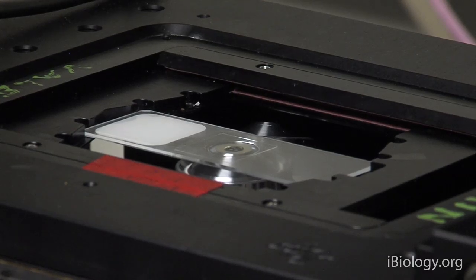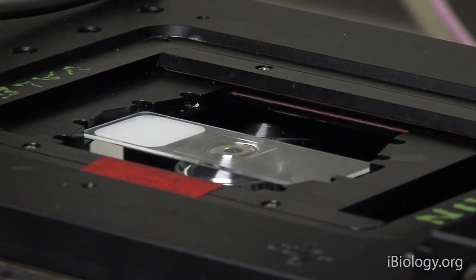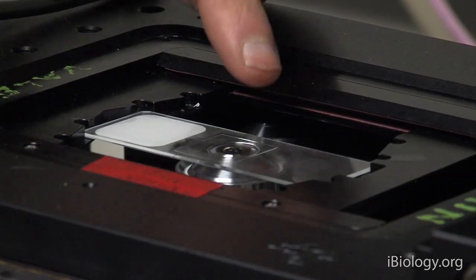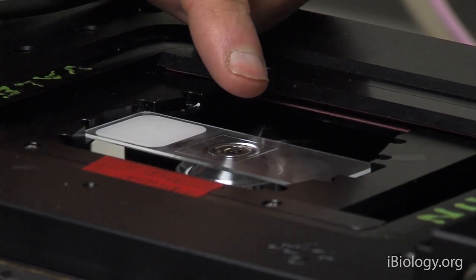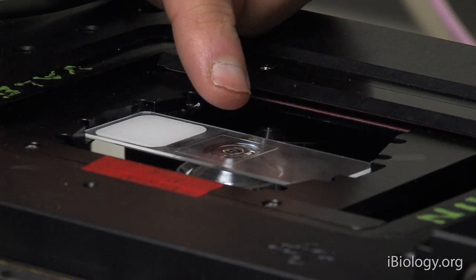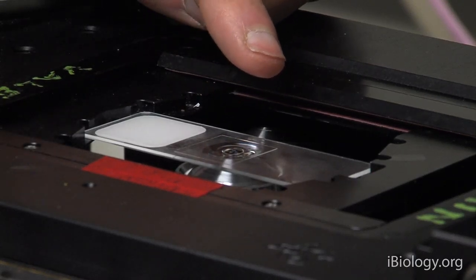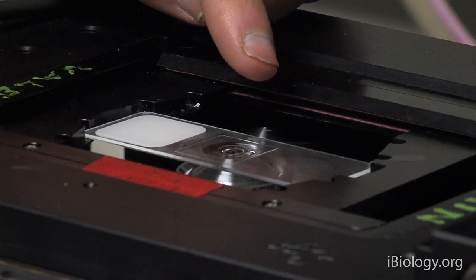But nevertheless, the best strategy is if you're concerned that you've gone overfocus, just stop, have a look at where you are, and then put your objective lens down, and just start the process all over again to try to find focus.